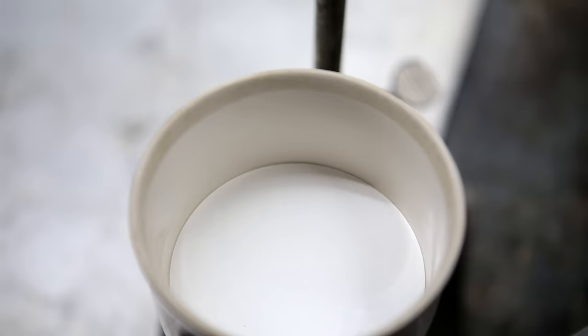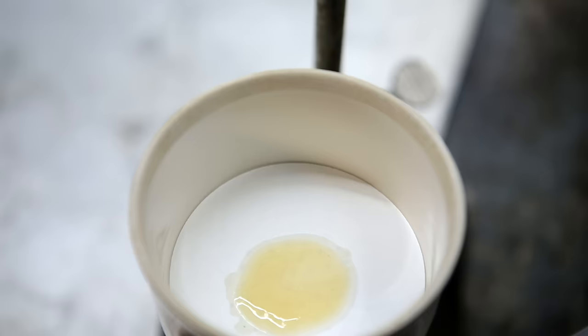This small amount of caffeine was then recrystallized using a little bit of 95% ethanol. The recrystallization test tube was placed in a freezer and then the contents were vacuum filtered. The caffeine crystals were allowed to dry under vacuum for a few minutes.